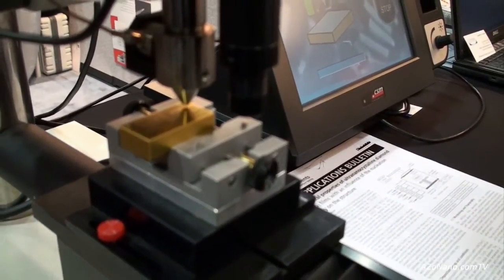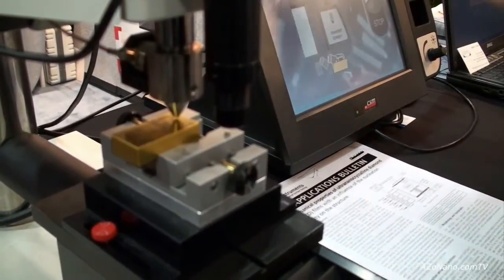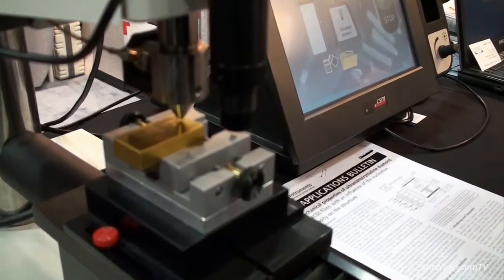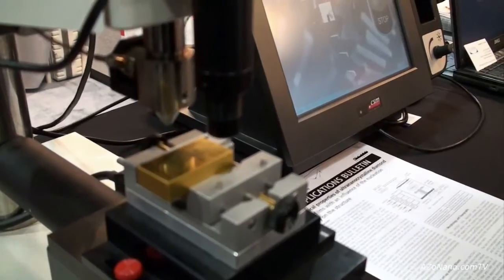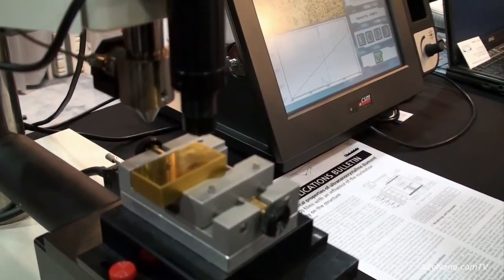So the point of this is to be able to correlate what we see under the optical microscope with the data set on the screen and we just wait a few seconds, it's saving the data, across comes the sample. And in a few moments we shall have the scratch in front of us.